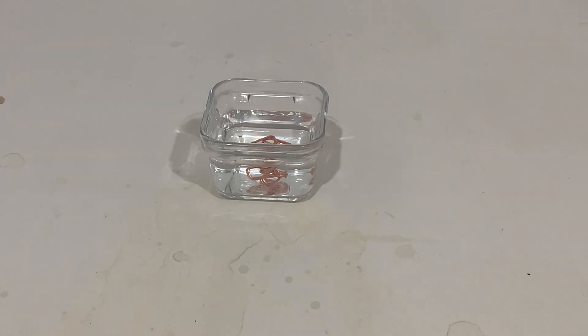So the first method of trying to dissolve copper would be to just keep the copper scrap inside of the hydrochloric acid for quite a while. Copper is less reactive than hydrogen, which is why we need to wait for it to oxidize. This process is very slow. I have no intention of waiting several days to show you the water became slightly more green. You can see the copper inside is a lot more shiny — that's because the dark copper oxide has been dissolved away.